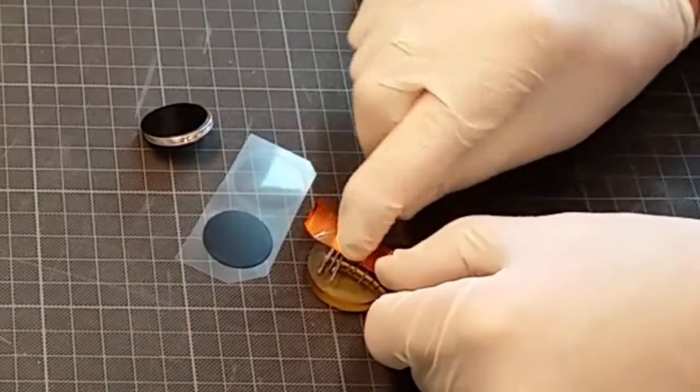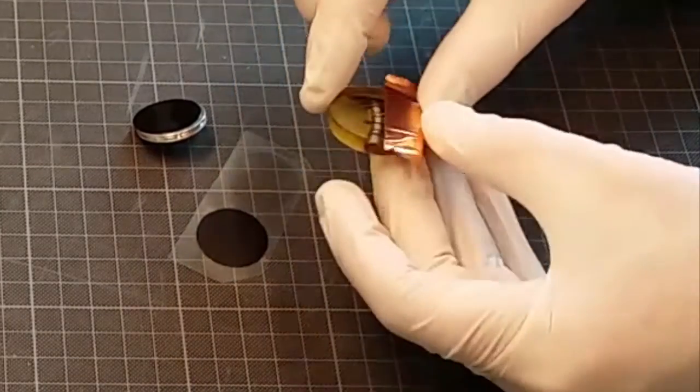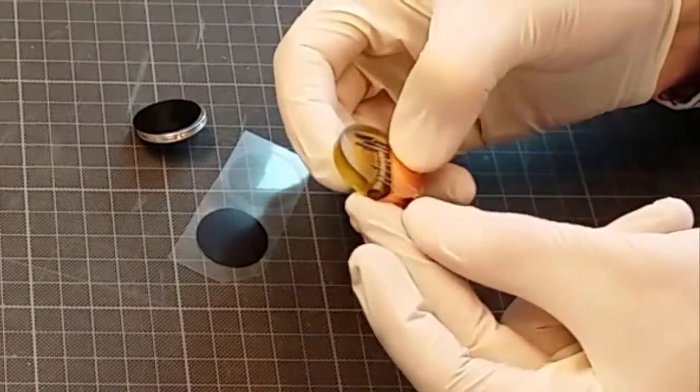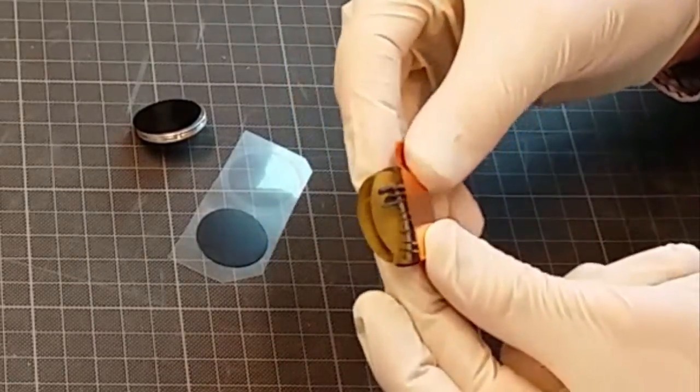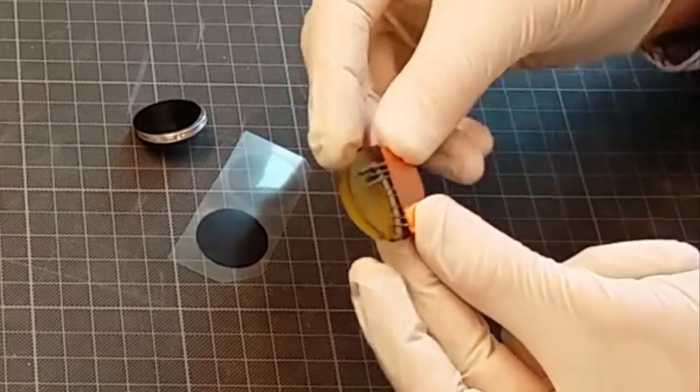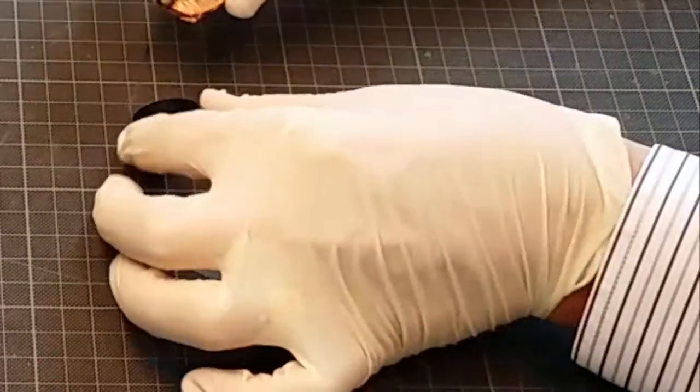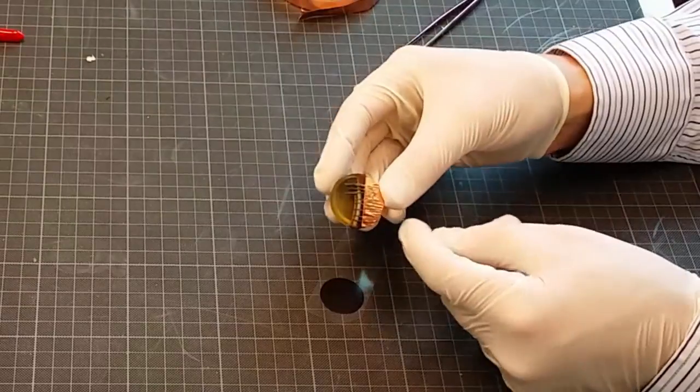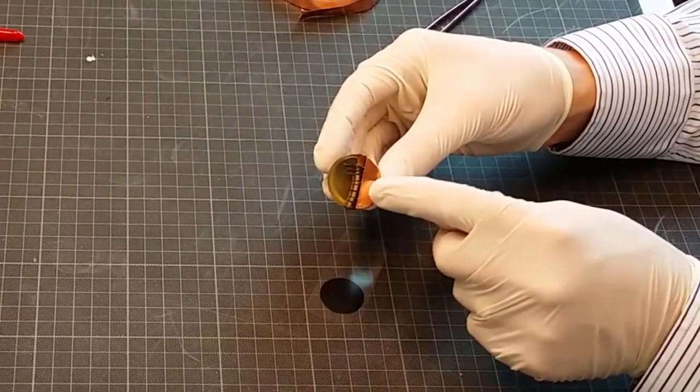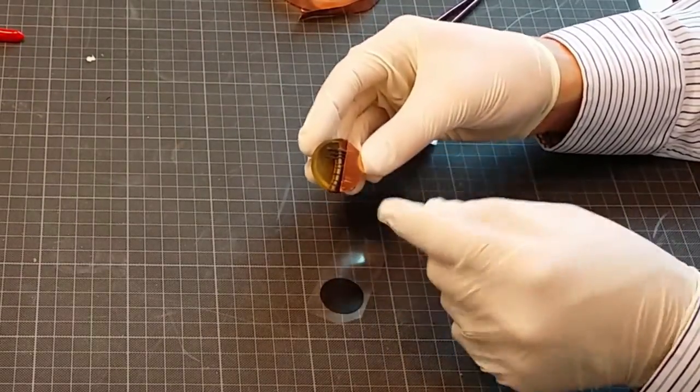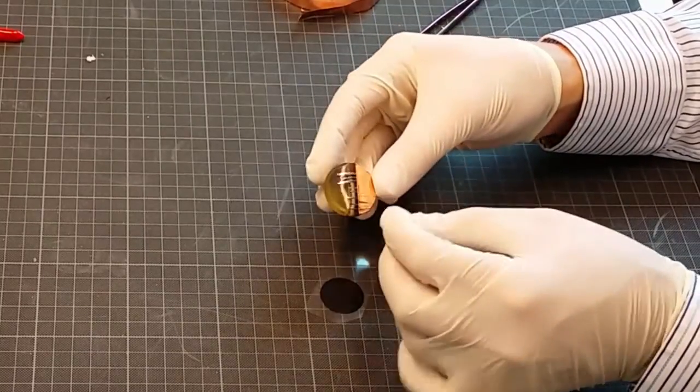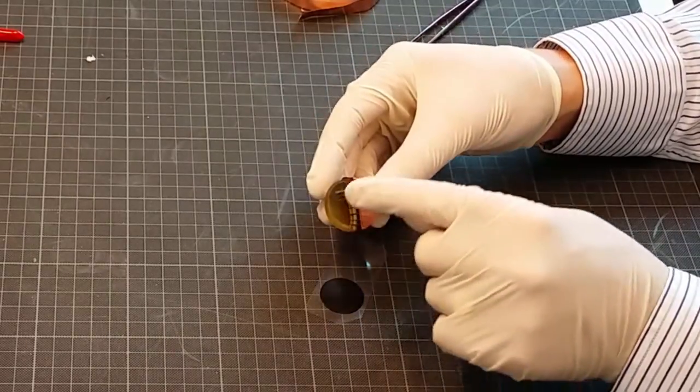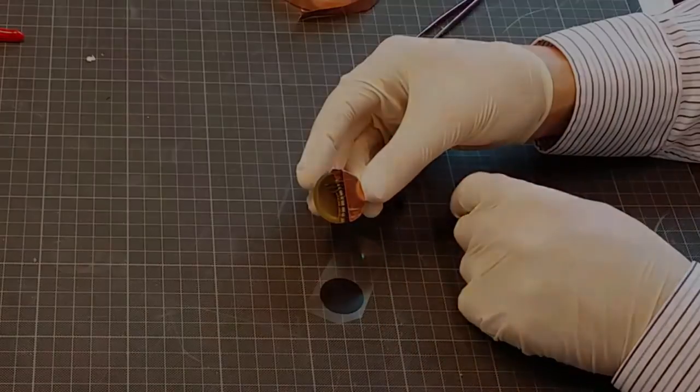And then I put this tape as close to it as possible. So I put it here straight across. And then I make sure that this tape goes around onto the bottom of the edge like this. And then we put that on top of the carbon tape. Then we have guaranteed a nice electric conductive pathway onto the top of the surface. So the next step will be to carbon coat it or gold sputter this. That will make the final conduction on top of the surface here.